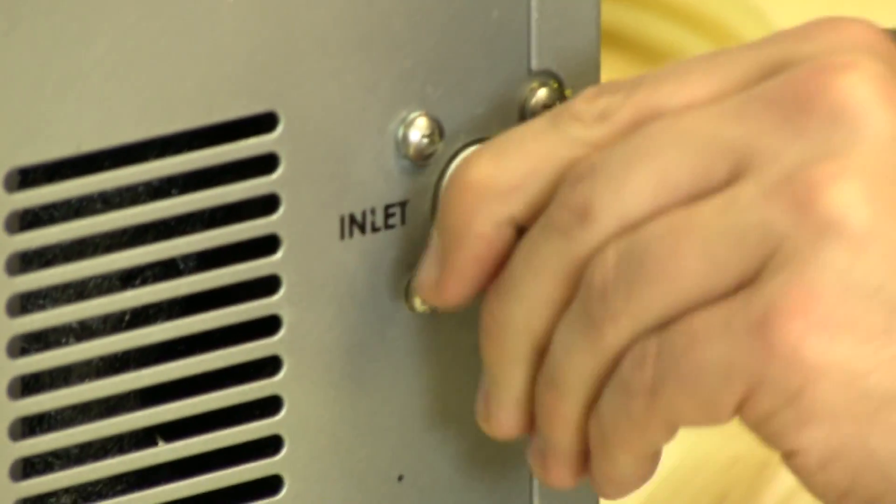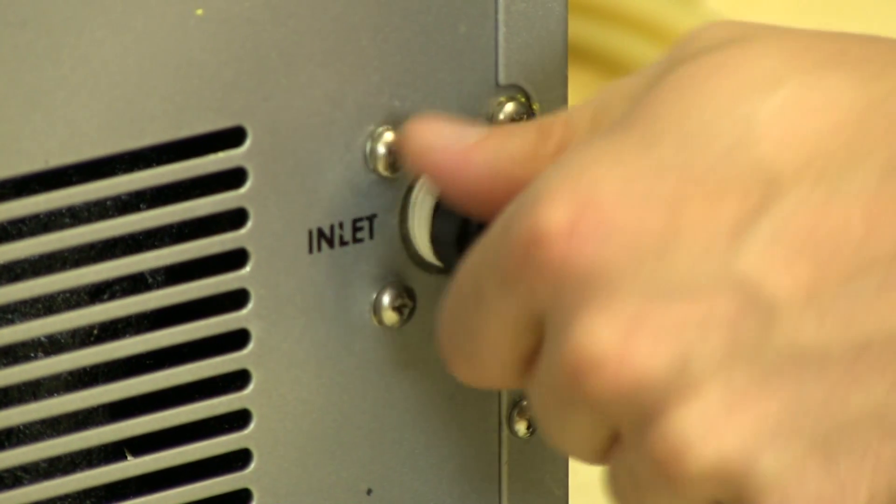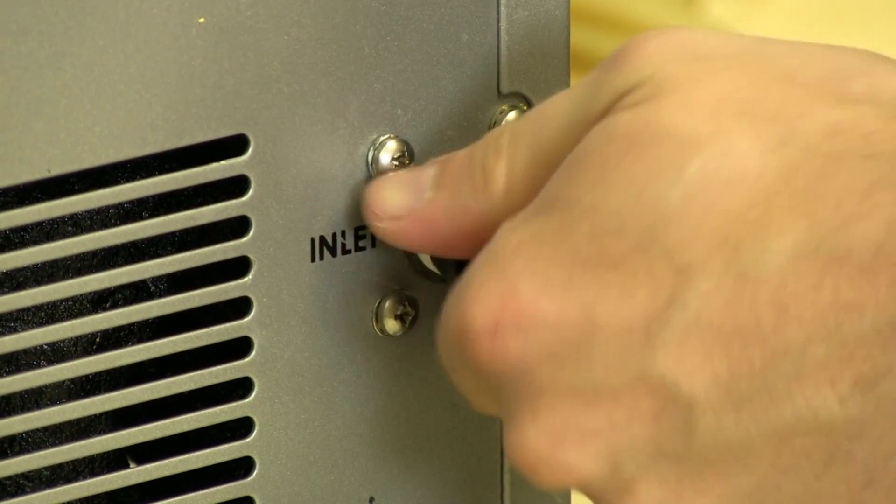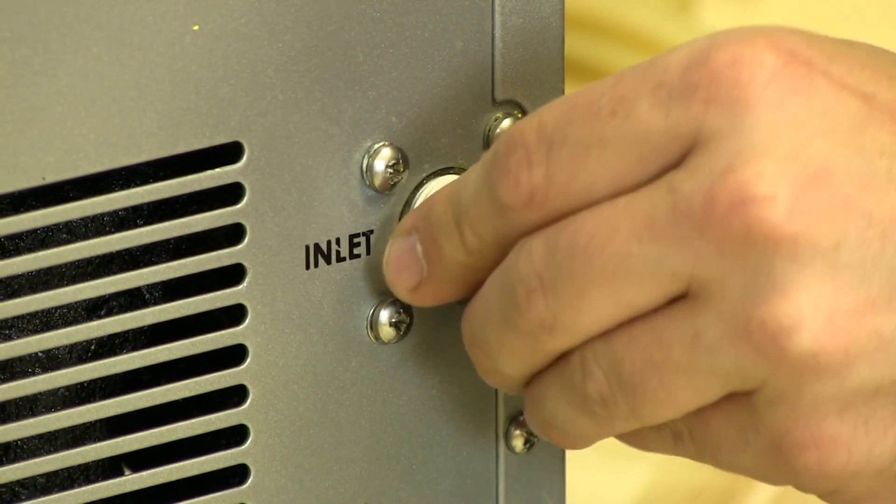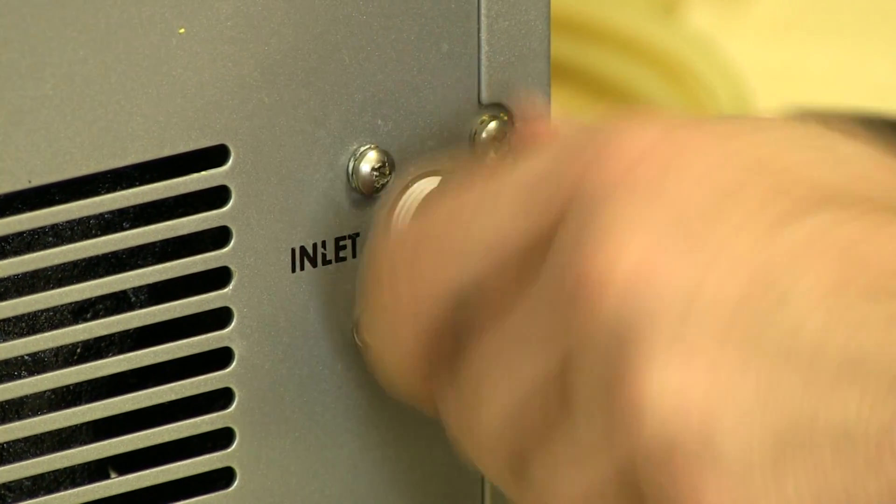Now we put the inlet in, threading it in gently. These are plastic, so be careful how you thread—we don't want to cross-thread.